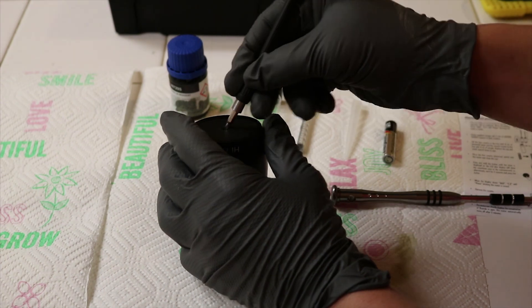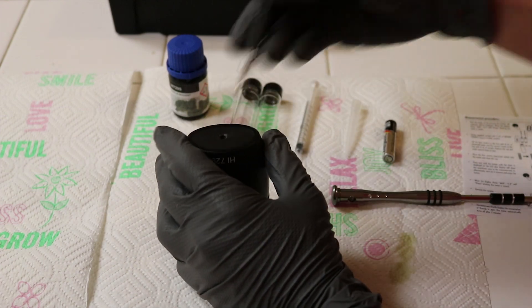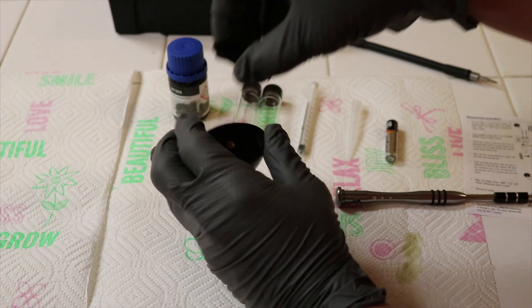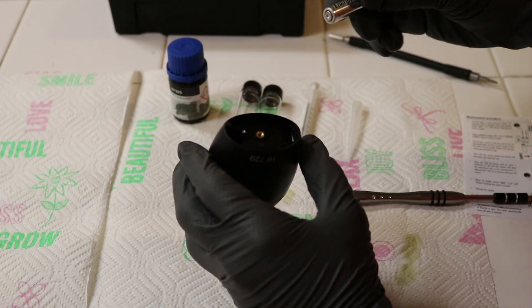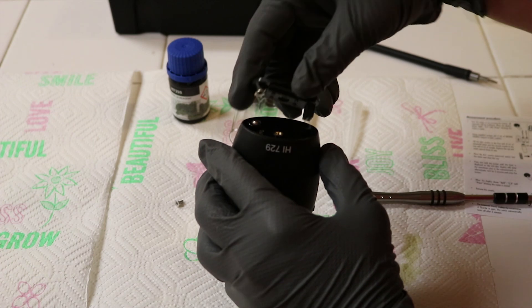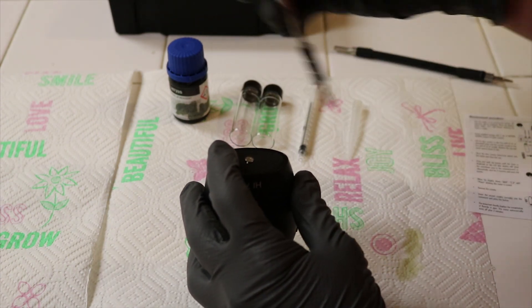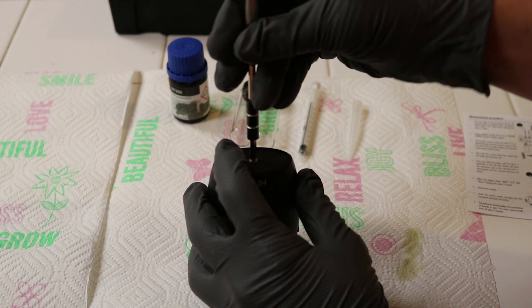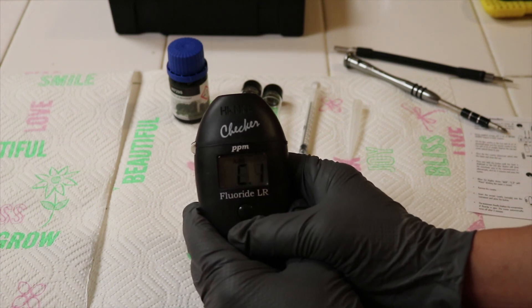I got a little flat head. I should be able to pop this out just like so. I'm just going to leave that like that, and it looks like the battery goes in just like that. Put it back down in there, put the screw back in. Let's see if it powers on — and it does. So cool, awesome.